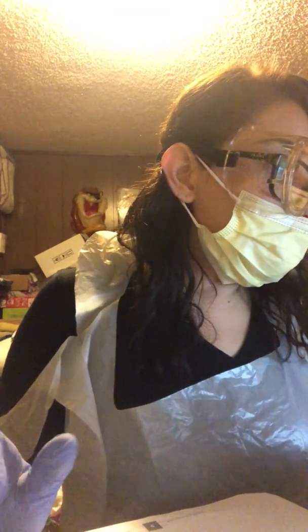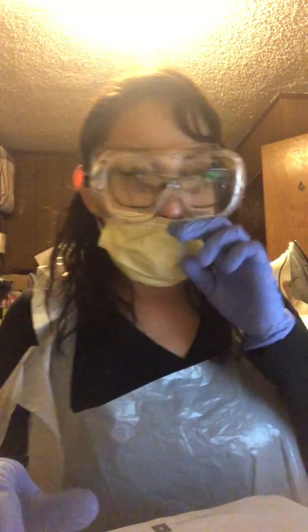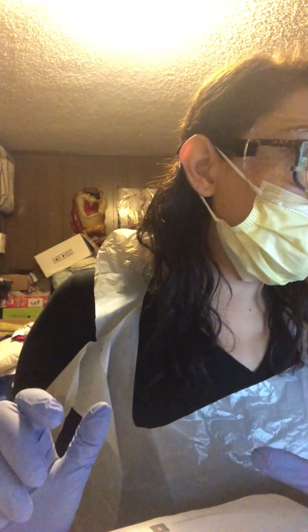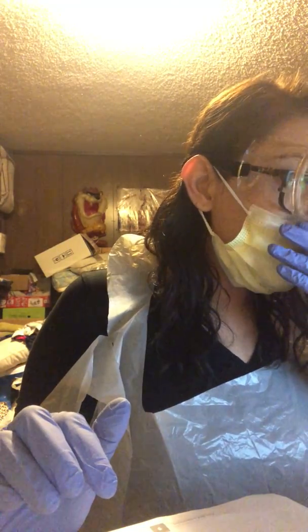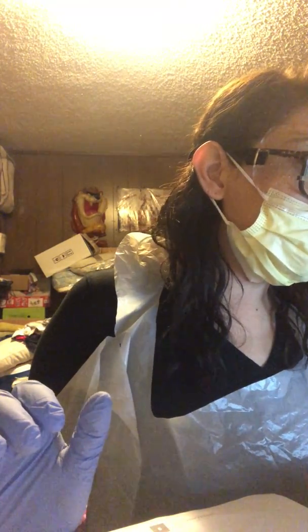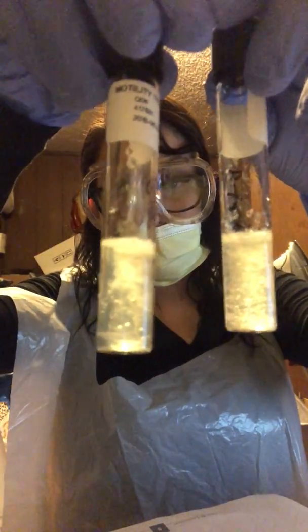And then what is functional media is one of the questions that the lab assistant asks, and it's pretty much media often used to determine the identity of unknown microbes and come in several forms. And there's a few very different forms of media. We have selective media. It contains agents that prohibit the growth of some organisms. Differential media enables many types of microbes to grow. Enriched media are supplemented with essential growth factors for organisms that do not grow well on typical media. Well, obviously, we have results here. And this is pretty cool, like I said.